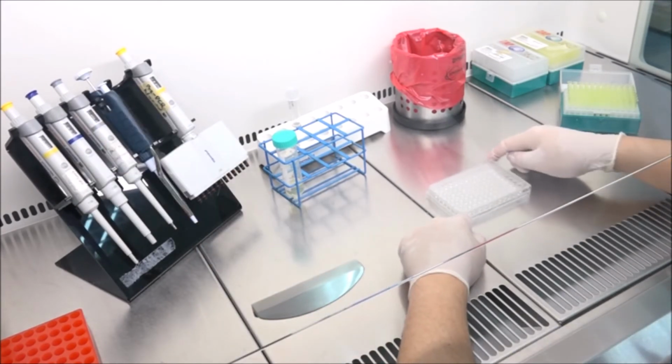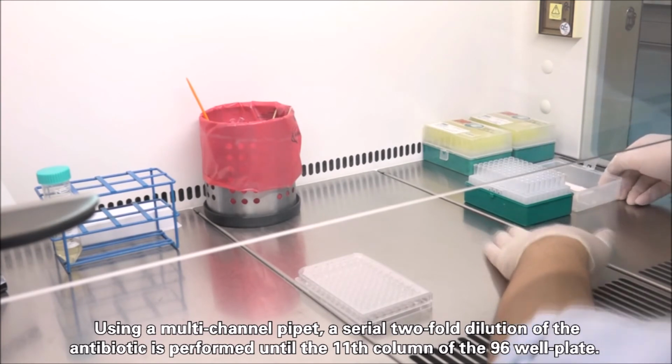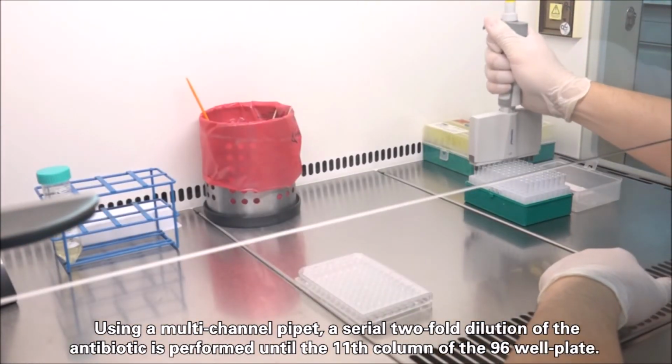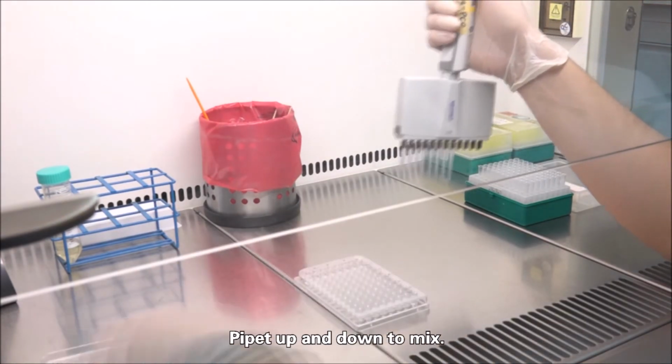Using a multi-channel pipette, a serial two-fold dilution of the antibiotic is performed until the 11th column of the 96-well plate. Pipette up and down to mix. Change tips after each round of mixing.